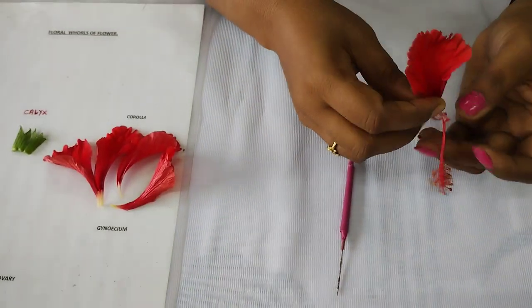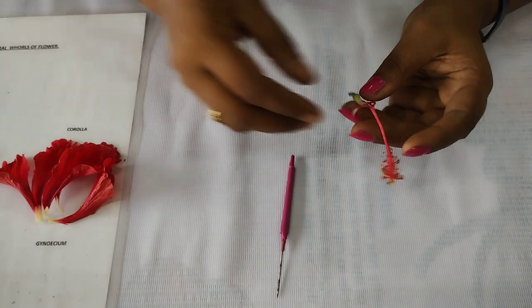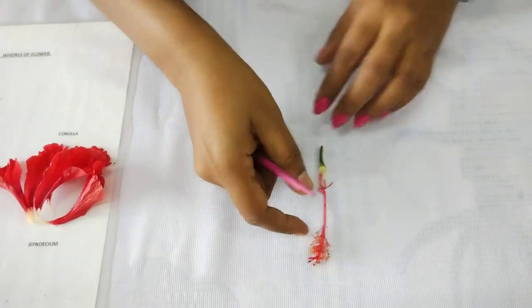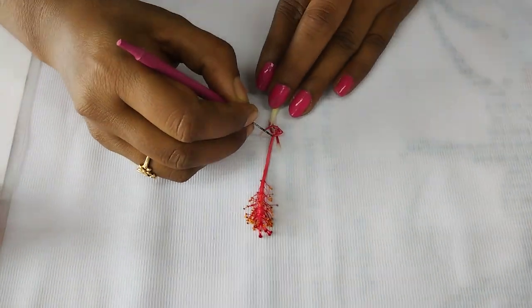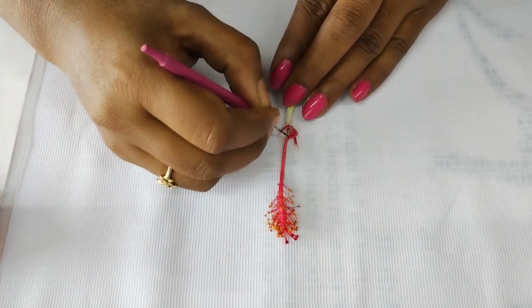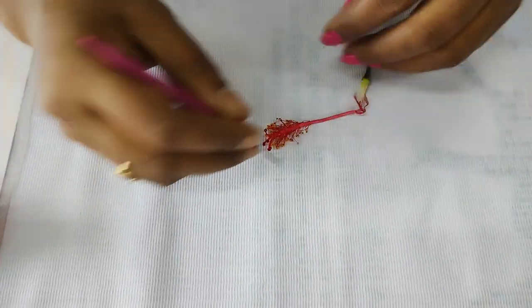This is the corolla part with five petals. Now the next step is to remove the androecium part.